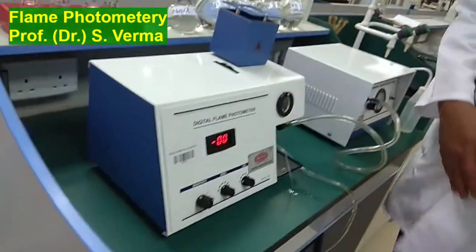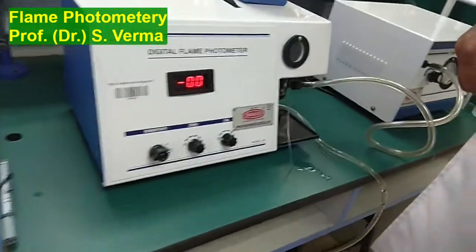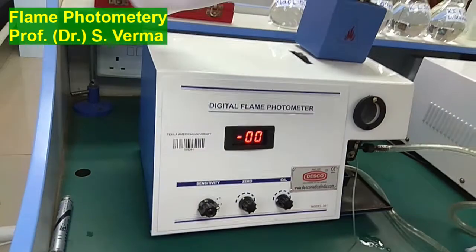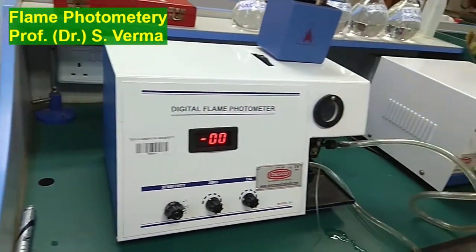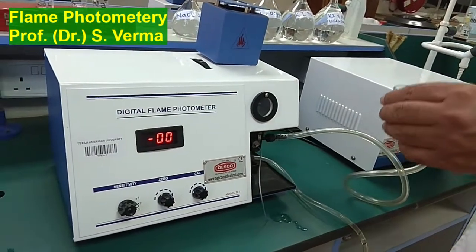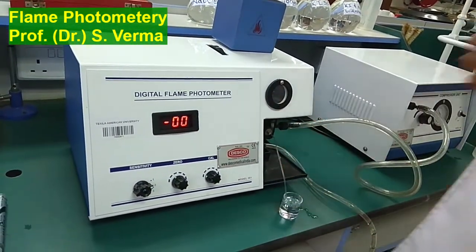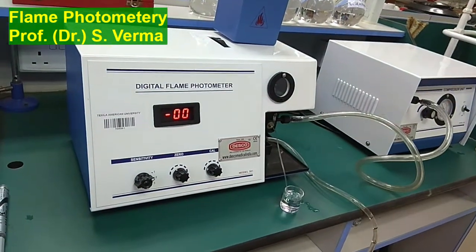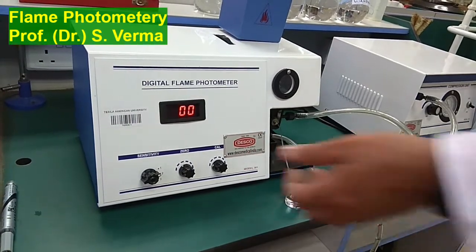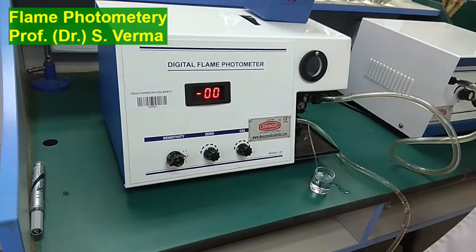Then we have this instrument with multiple knobs we'll be using as we work with this experiment. So the first thing to do is to take distilled water. In this particular cell, I'm taking some distilled water, and I'll be dipping this capillary in the distilled water. With distilled water, my display should be 0. I'll start with sensitivity 1. Sensitivity at 1, display with distilled water should read 0.